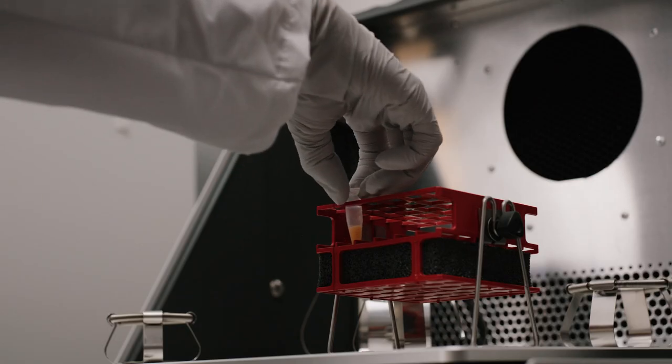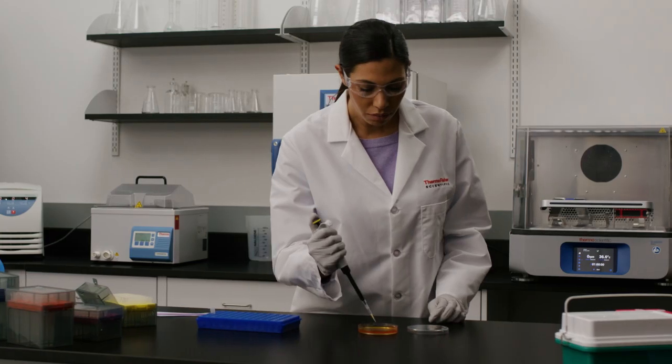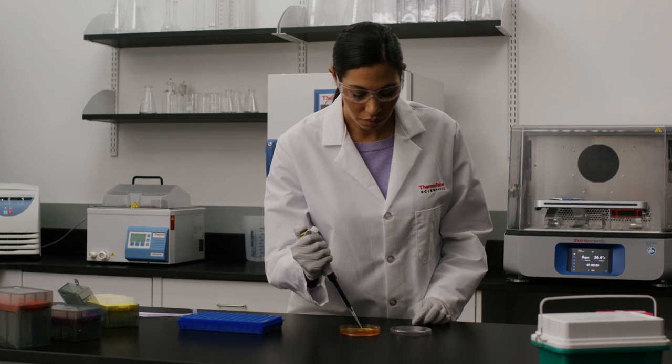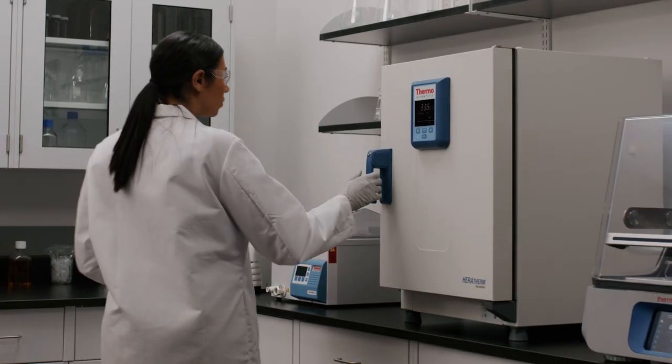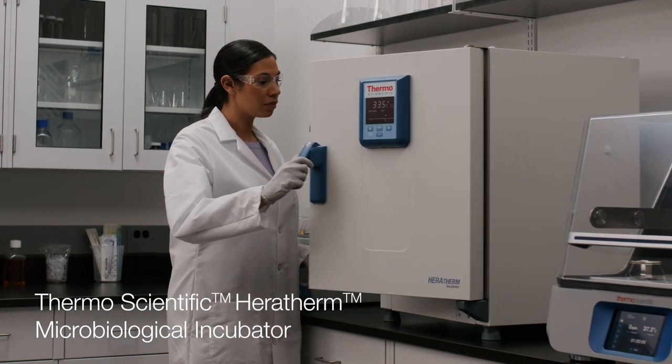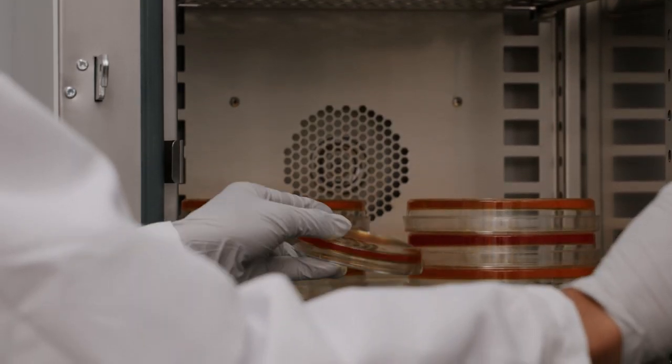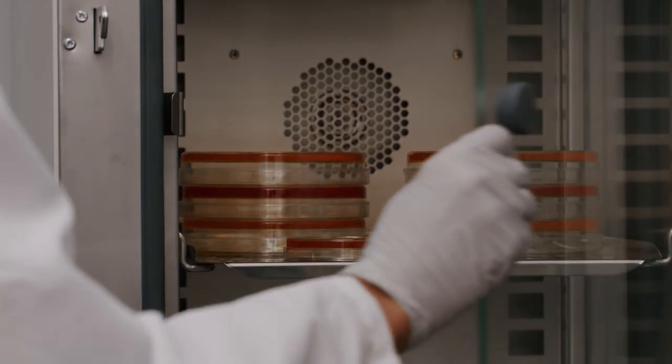Now that an hour has passed, Maria removes the tube from the shaker, pipettes some of the solution into an agar plate, and spreads it out. She then places the plate in a ThermoScientific Heratherm microbiological incubator at 37 degrees Celsius, where it will remain overnight.